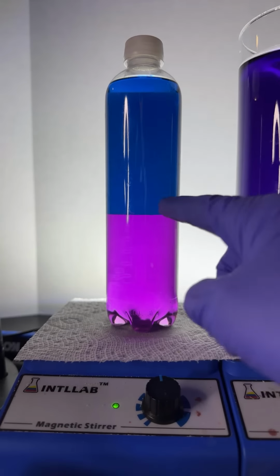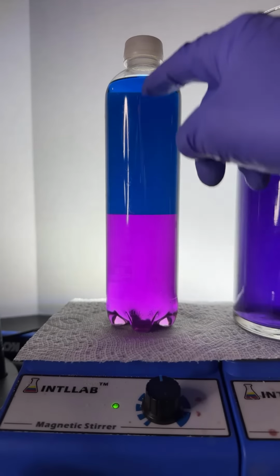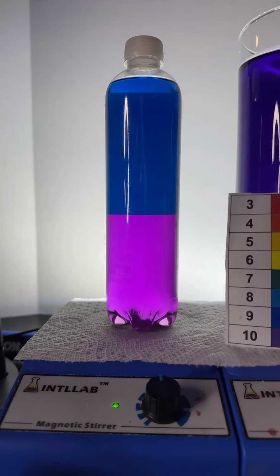It undergoes a slight chemical change that makes it dissolve in the saltwater layer better, and everything else dissolves up here in the top. At all other pH values, they all tend to go to the top layer, but when you get to a high pH, the phenolphthalein crashes out and goes into the saltwater. Isn't that cool, man? Is that not cool?